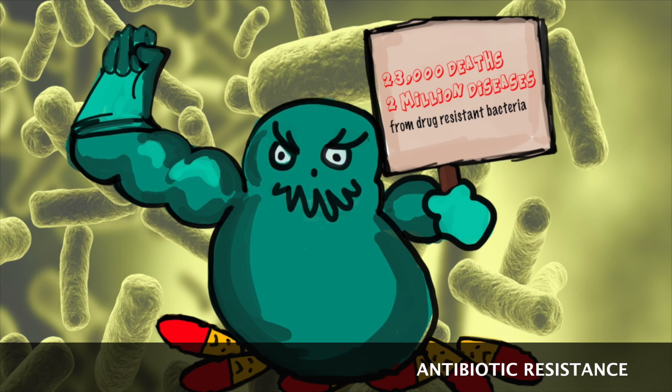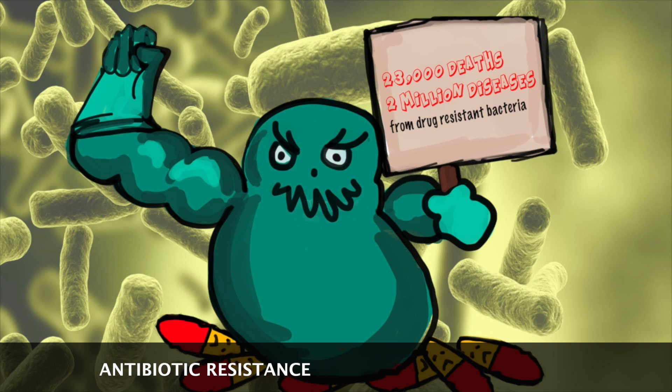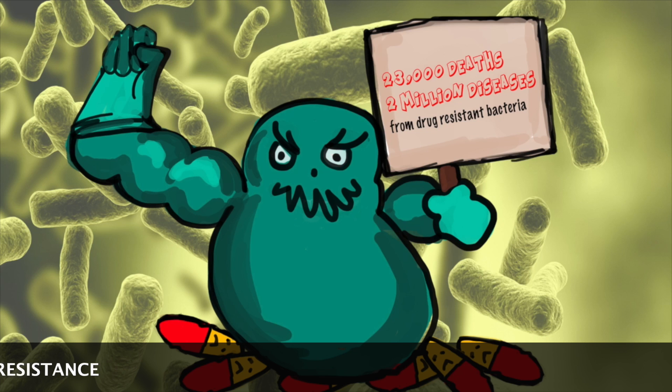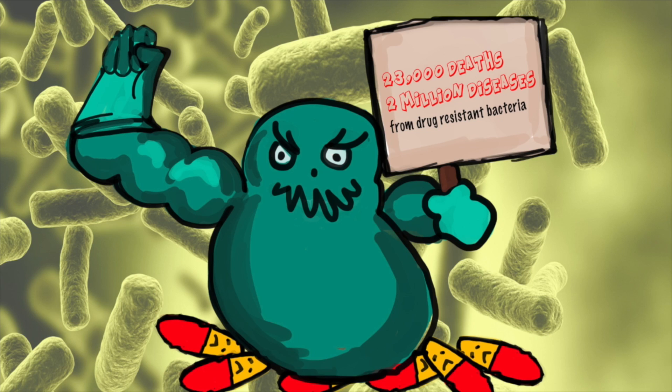Since antibiotic resistance is a significant threat to public health, researchers all over the world are trying to discover new antibacterial drugs. After identifying a new antibiotic, we have to determine its effective dose, or minimum inhibitory concentration.